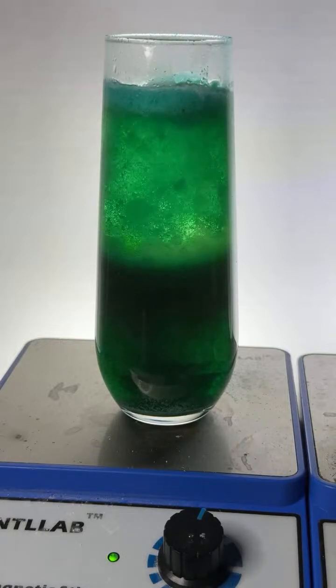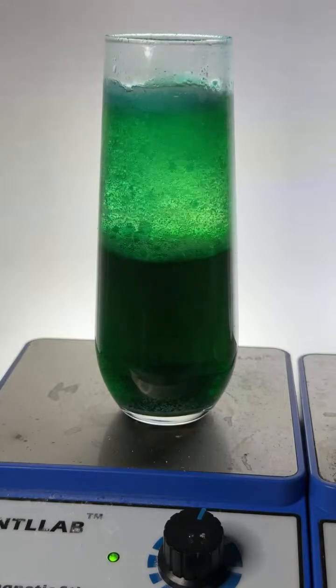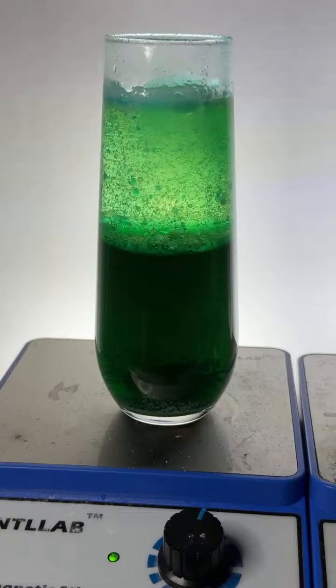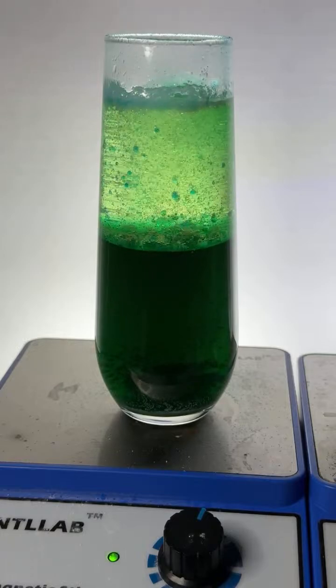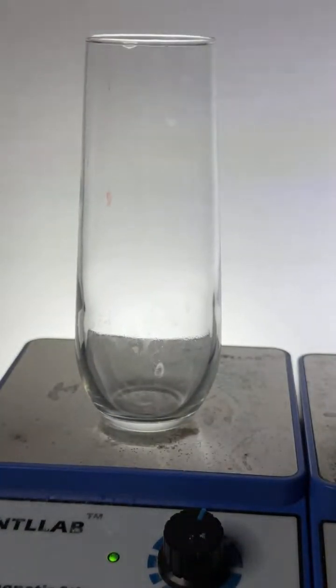Okay, I got another Alka-Seltzer tablet. We can do this again. Give me a second. New Alka-Seltzer tablet. We'll get us another flask. A little bit more oil. I got my water. My water's also kind of hot, so the reaction's going to go pretty quickly. Let me add cooler water this time. This will be colder. This won't go as quick.